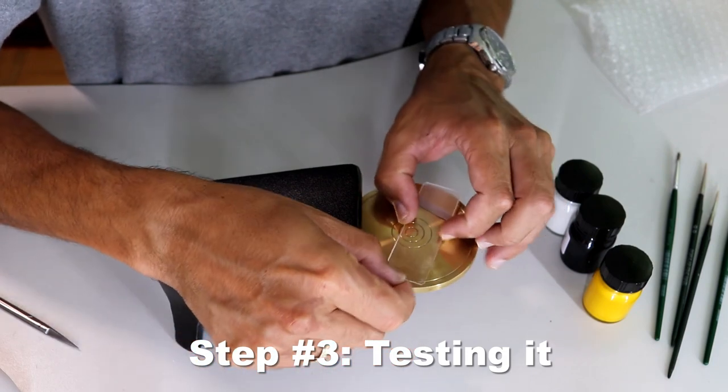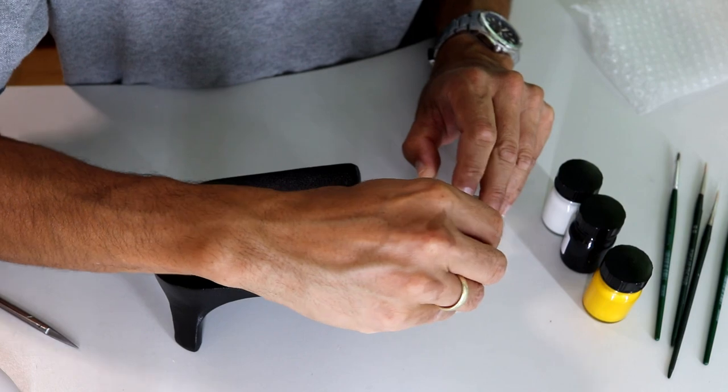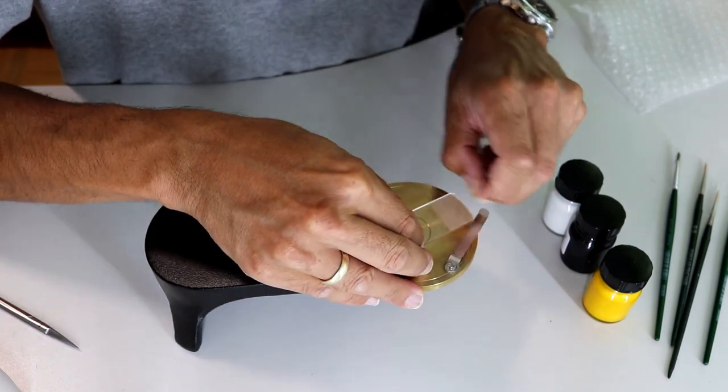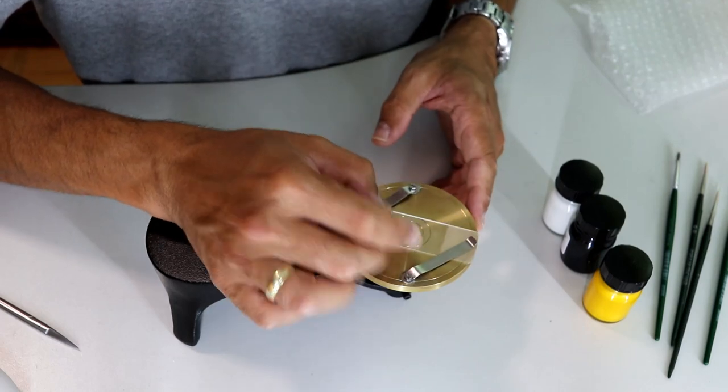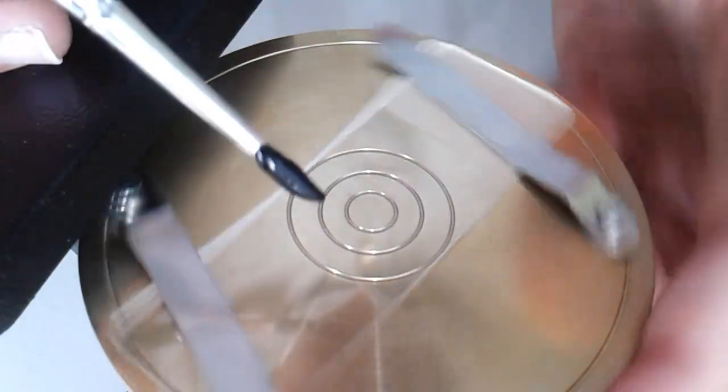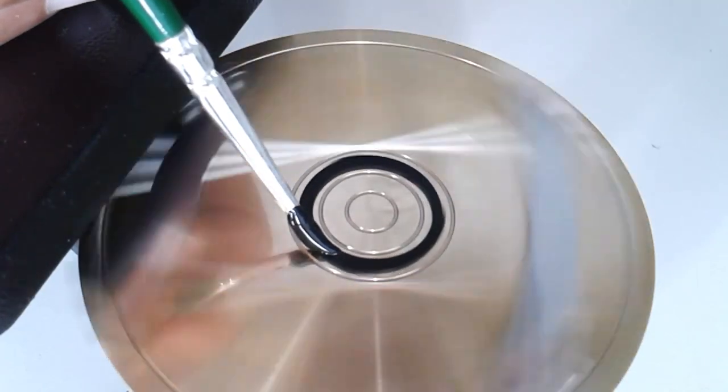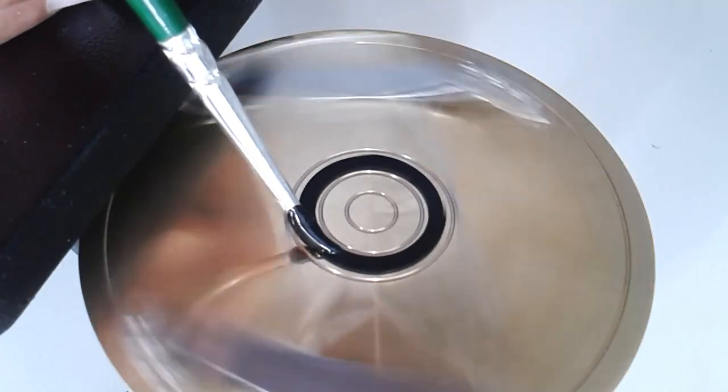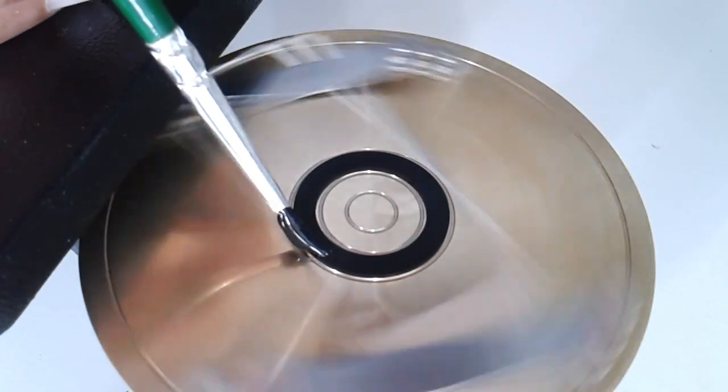Now I'm trying it out. What I'm doing first is I'm trying to simply put a spacer ring on this slide. I'm clipping the slide using the two clips, obviously centering everything, and then I'm simply trying to apply some of the black paint here. I'm rotating it, giving it a spin. That's basically what I'm doing right now—I'm applying a spacer ring.